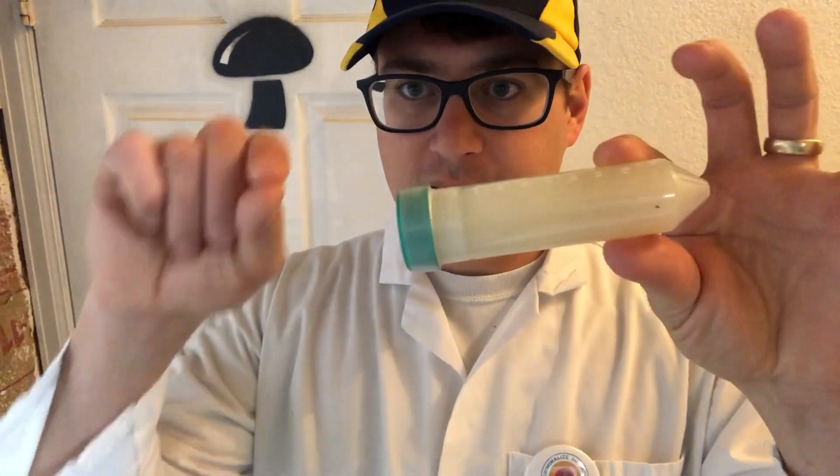When creating your mother stock cultures, you want to minimize contamination. One way I work with these in the hood is to tilt them sideways and use my scalpel to make incisions — that way the only chance of contamination is through that small opening. I've had very good success using slants. I'd also note that just because it's in a test tube doesn't make it a slant.